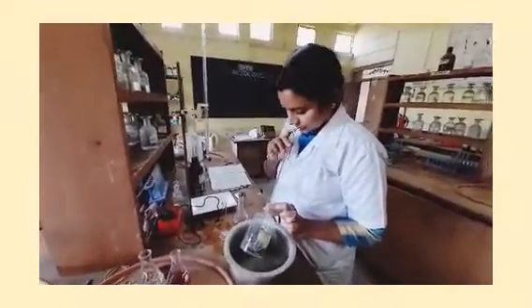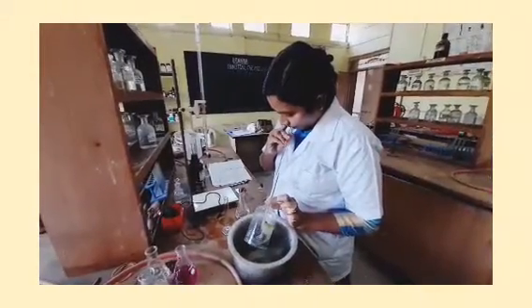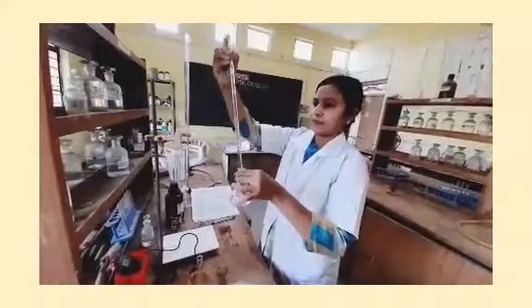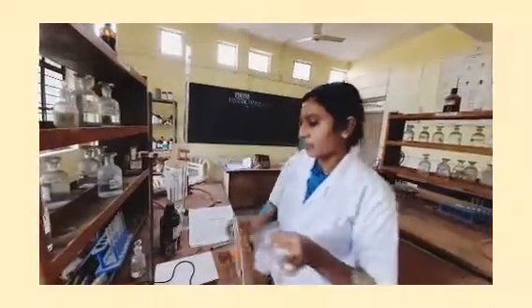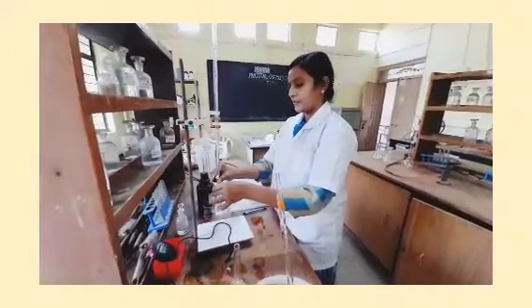Two minutes is over. After five minutes I will take the second reading. I just suck out 5 ml of the reaction mixture — slowly remove the pressure of your finger from the pipette — and up to 5 ml I add the reaction mixture into the conical flask, which already contains cold water and phenolphthalein indicator. Then I repeat the same procedure, adding drop by drop NaOH into the reaction mixture.